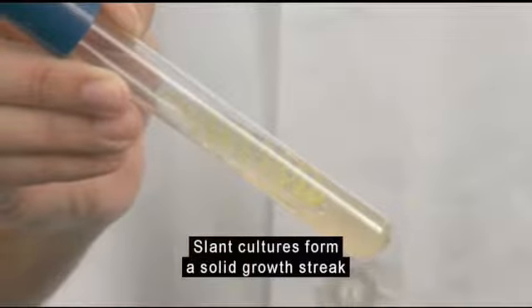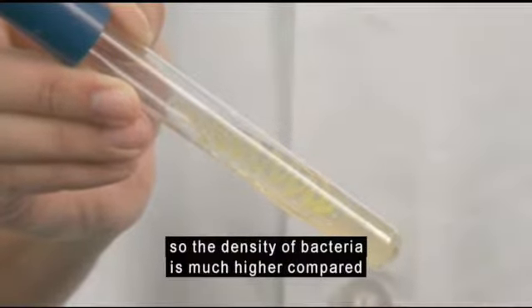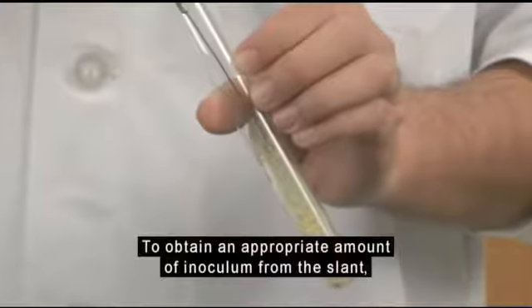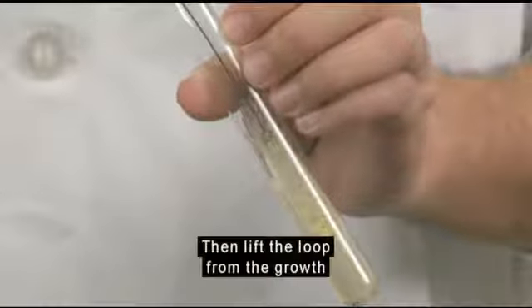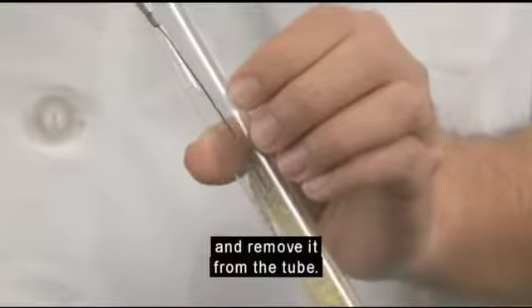Slant cultures form a solid growth streak on the surface of the agar, so the density of bacteria is much higher compared to a broth culture. To obtain an appropriate amount of inoculum from the slant, simply touch the edge of the loop to the growth streak. Then lift the loop from the growth and remove it from the tube. Do not drag the loop over the culture surface.